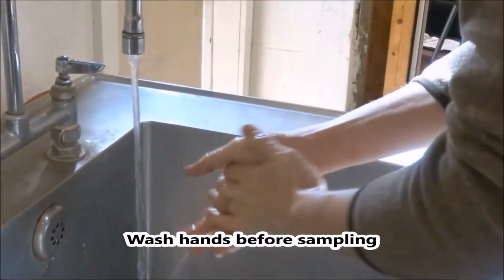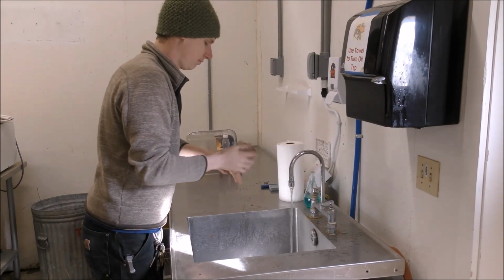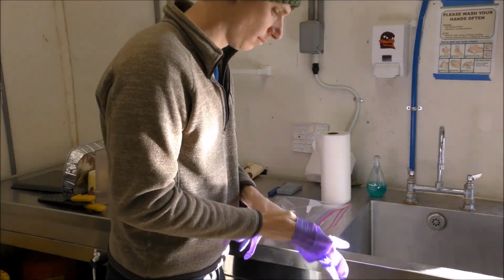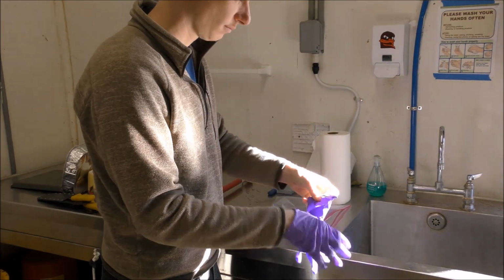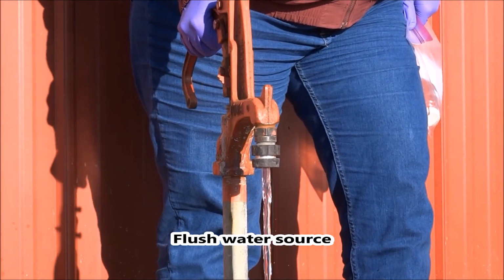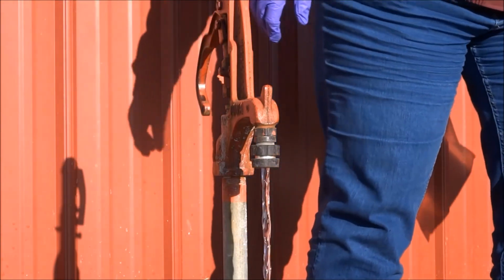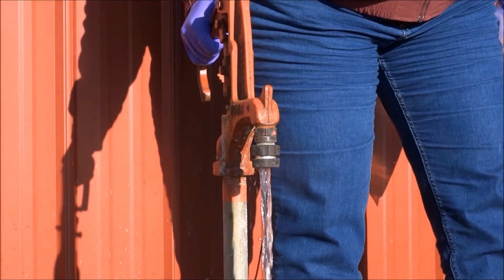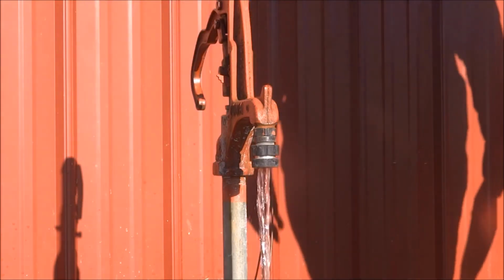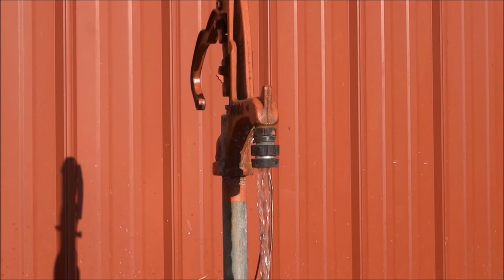Just before sampling, wash your hands with soap and water for 20 seconds, then dry hands with paper towels and put on nitrile gloves. This will help prevent cross-contamination of the sample. Turn on the spigot and let the water run long enough so that you are testing water from the water source and not just the water that has been sitting in the pipes or the hose. Depending on your water system, this could be as long as 10 minutes or as short as 5 minutes of flushing time. If you know the volume of your system and flow rate, allow 2 to 3 times the volume of the system to flush prior to sampling.